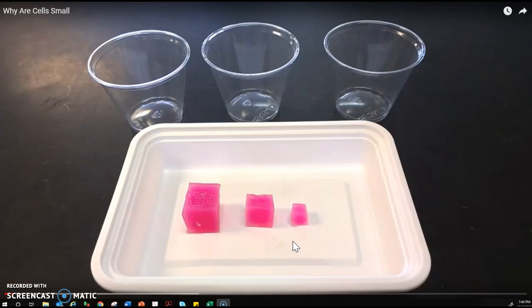I have cut them into three different size cubes. The biggest being a two centimeter by two centimeter by two centimeter. The medium one is one by one by one centimeter, and the smallest is 0.5 by 0.5 by 0.5 centimeters.